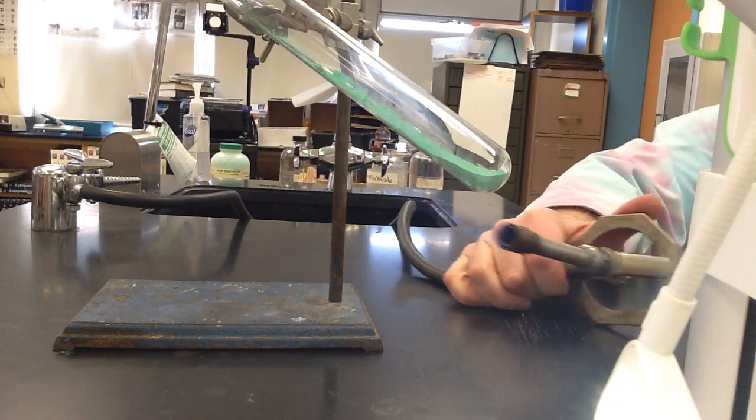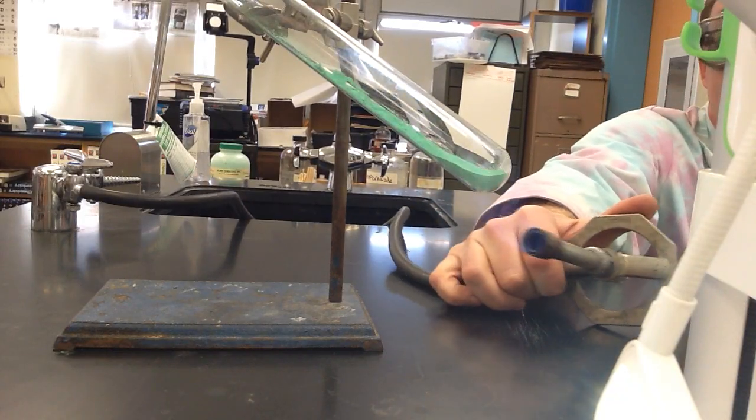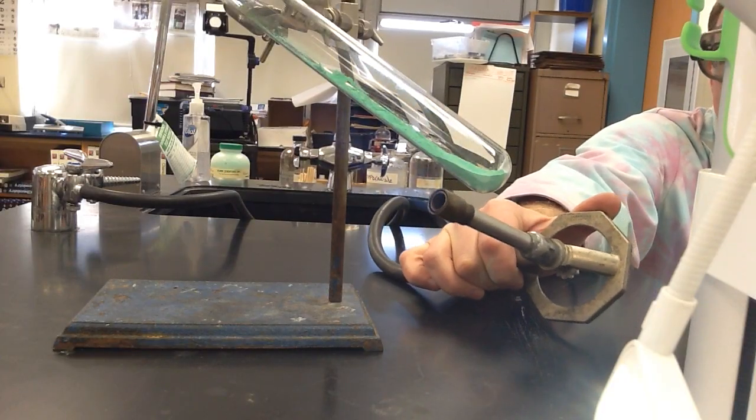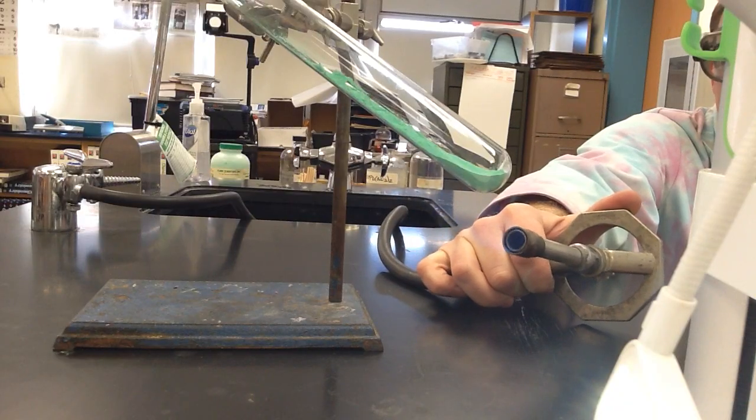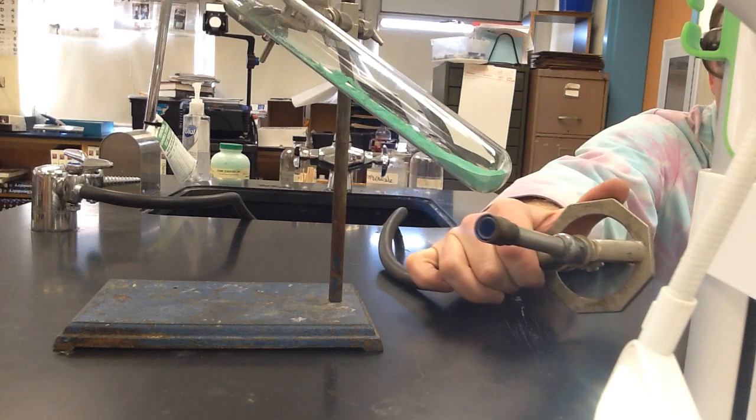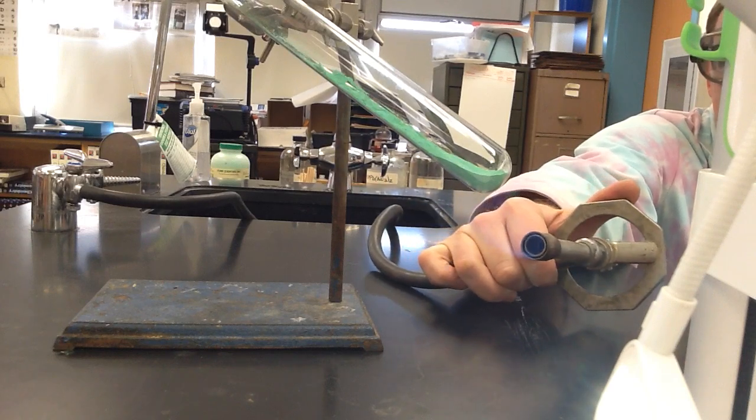I don't want it to get super hot, and we want to look at the surface of the powder and see if anything cool is happening. Look for color changes, too. It takes a while to get going.